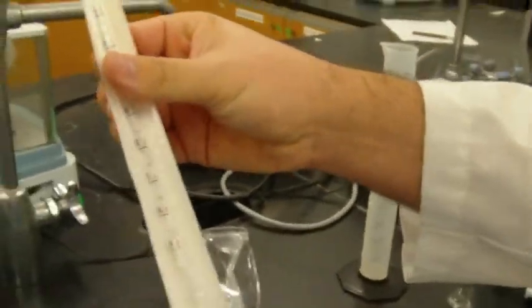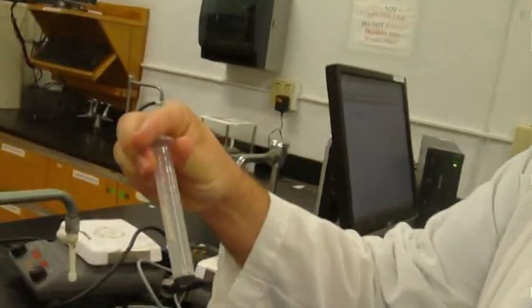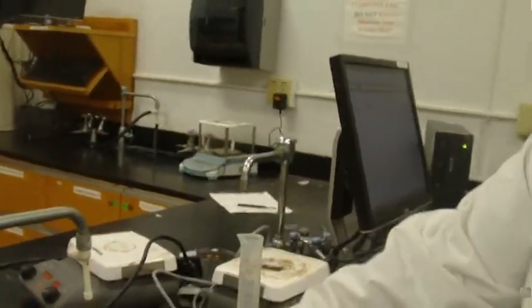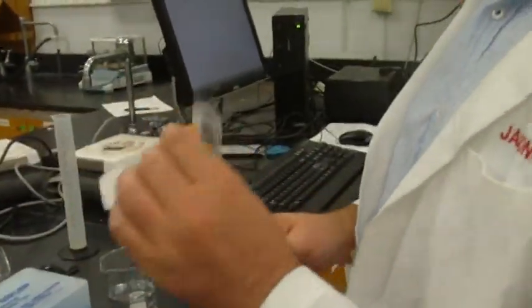Other 2 tools, right? Other 2 tools. Right. Which are, again, what did you choose? A pipette. Is that a 1 milliliter pipette? And a 10 milliliter graduated cylinder. 10 milliliter graduated cylinder. Great. So how do we get water in that pipette? We can use a pipette pump. Up and down. Pull it off.